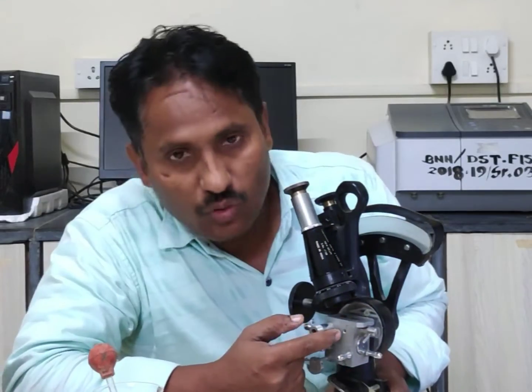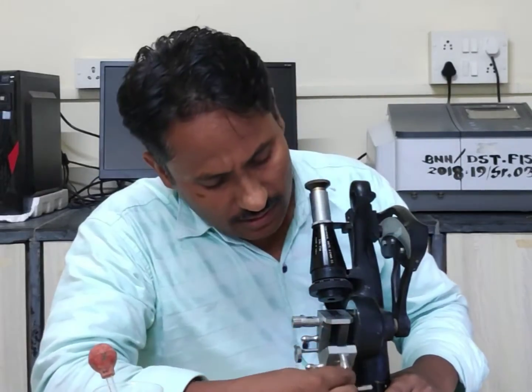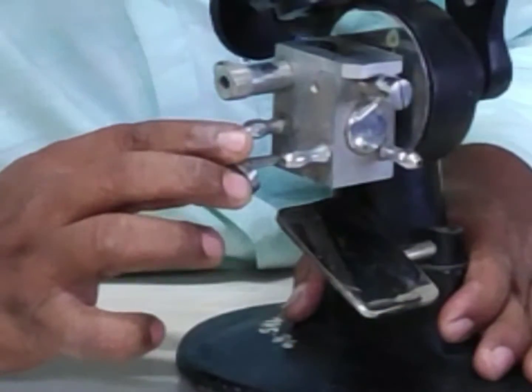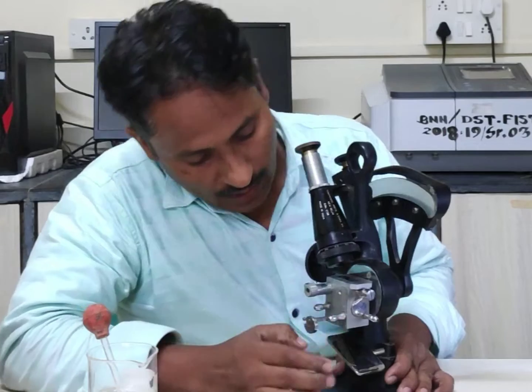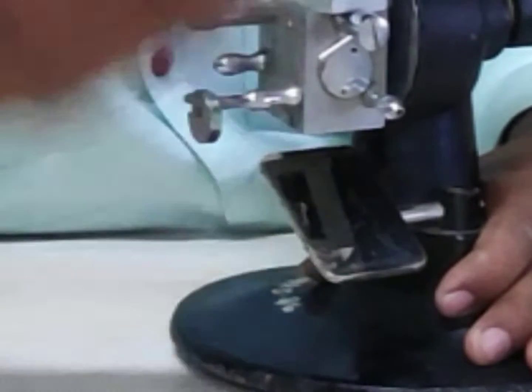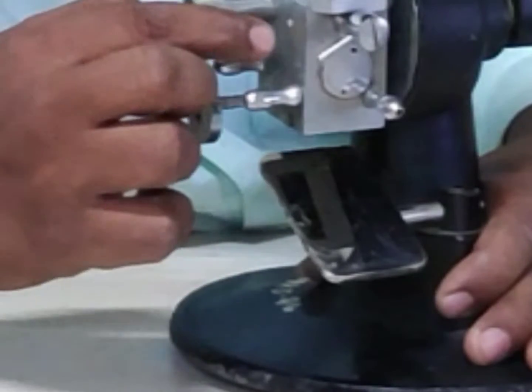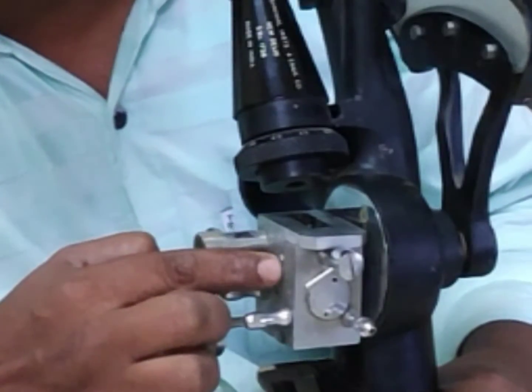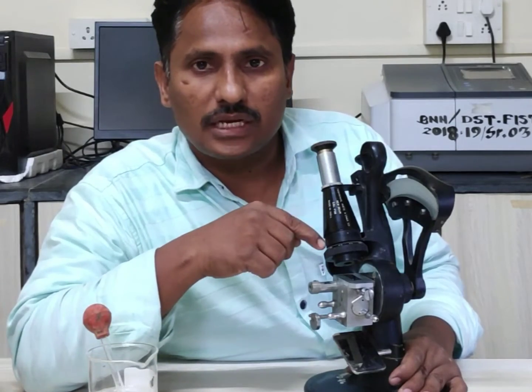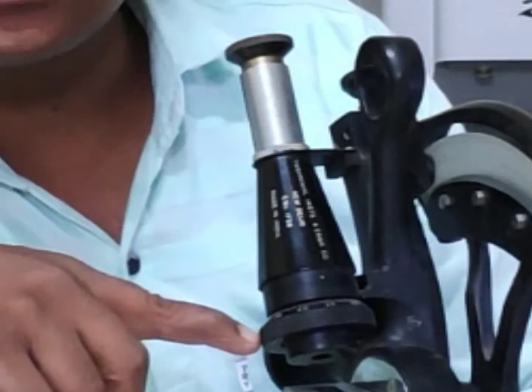There is a small hole through which we can put the sample, or we can also put the sample directly on this side. Then we close this prism box. This is the mirror, used to get clear light. When light is present, it is reflected from this mirror into the prism box, and then the refracted light can be observed with this telescope.